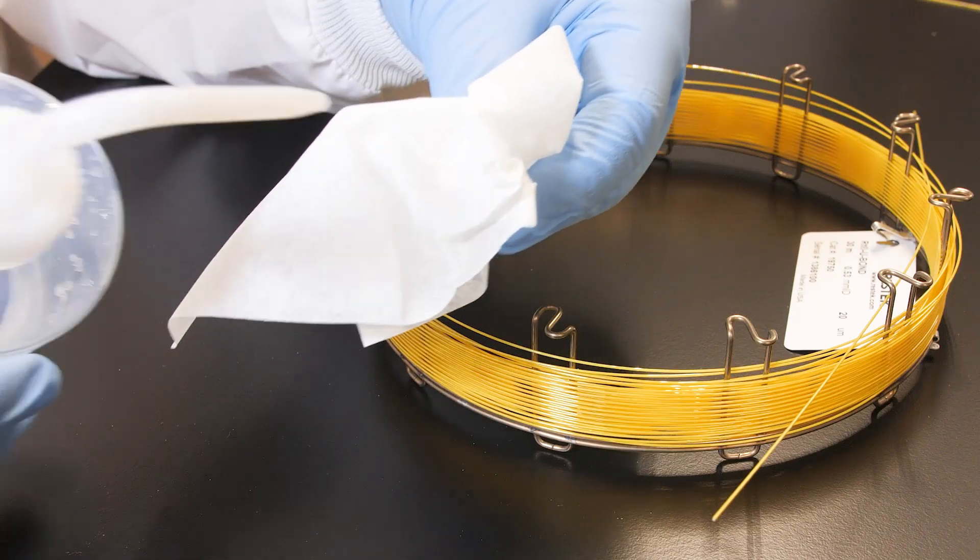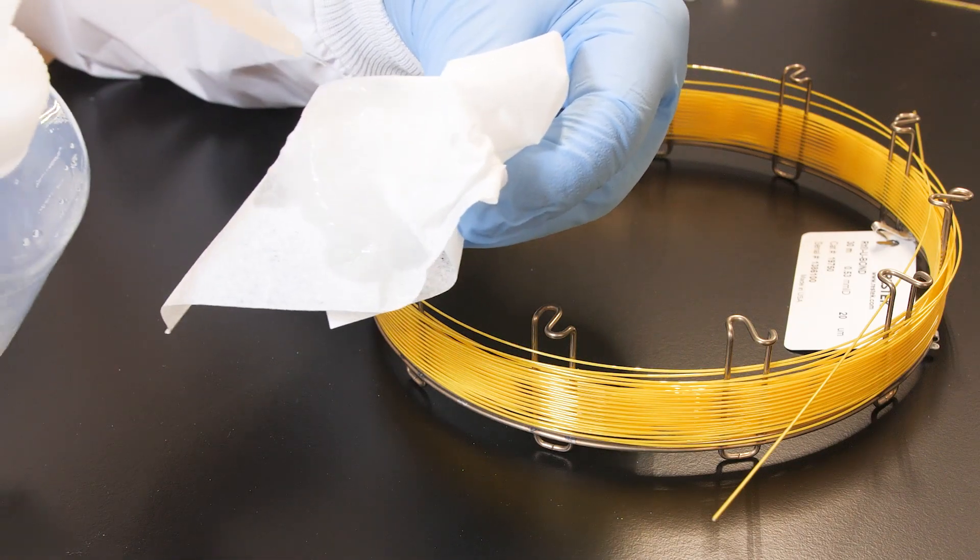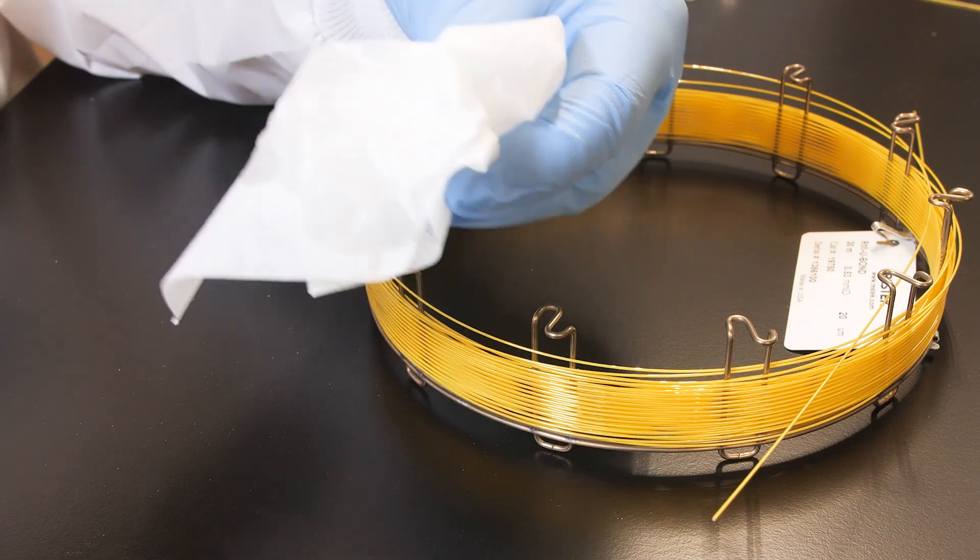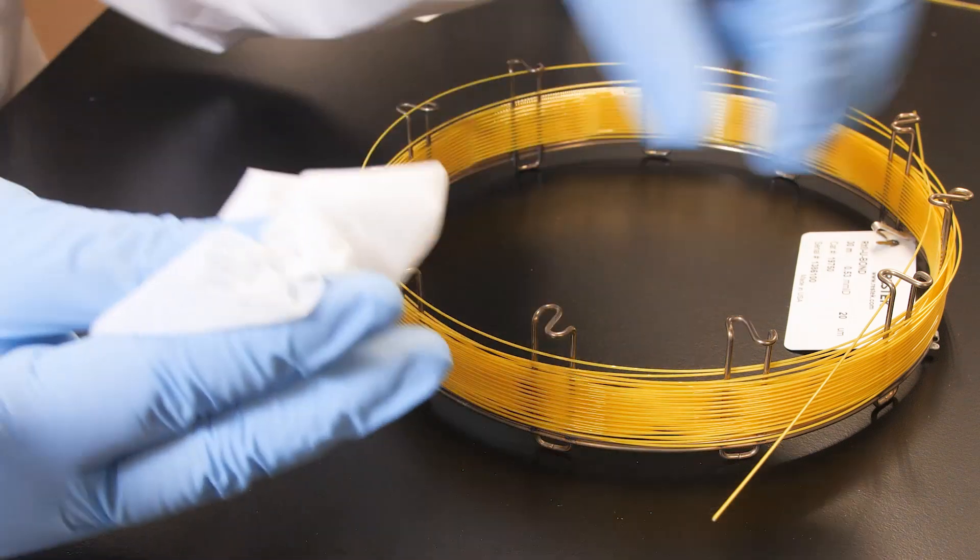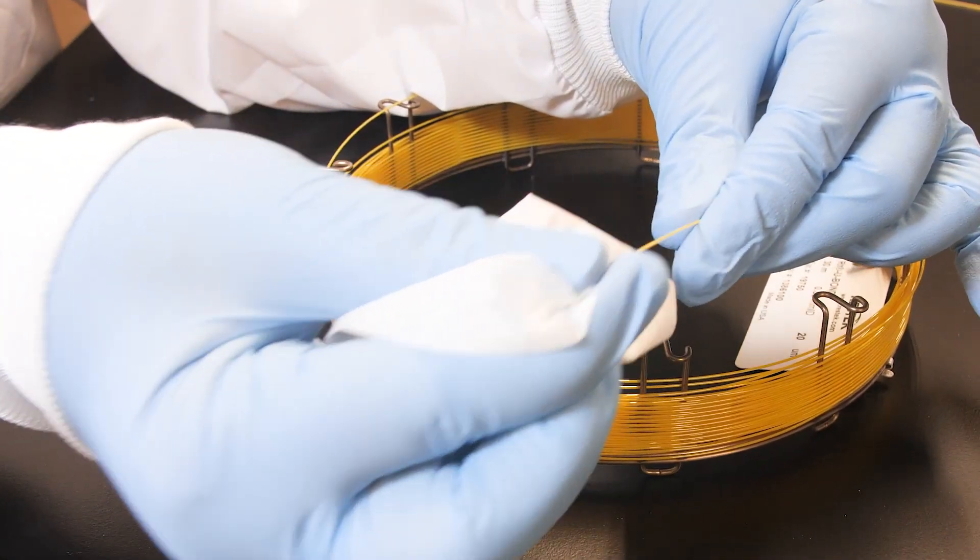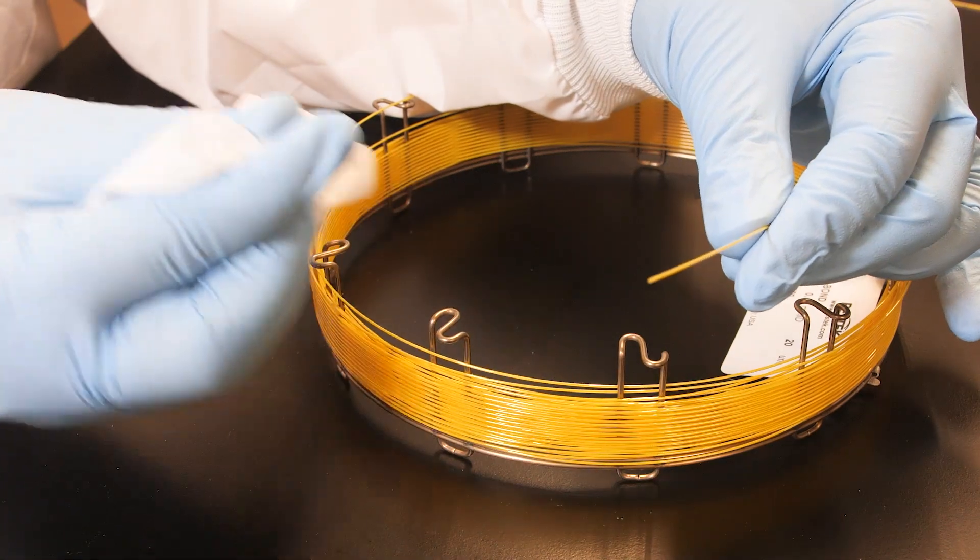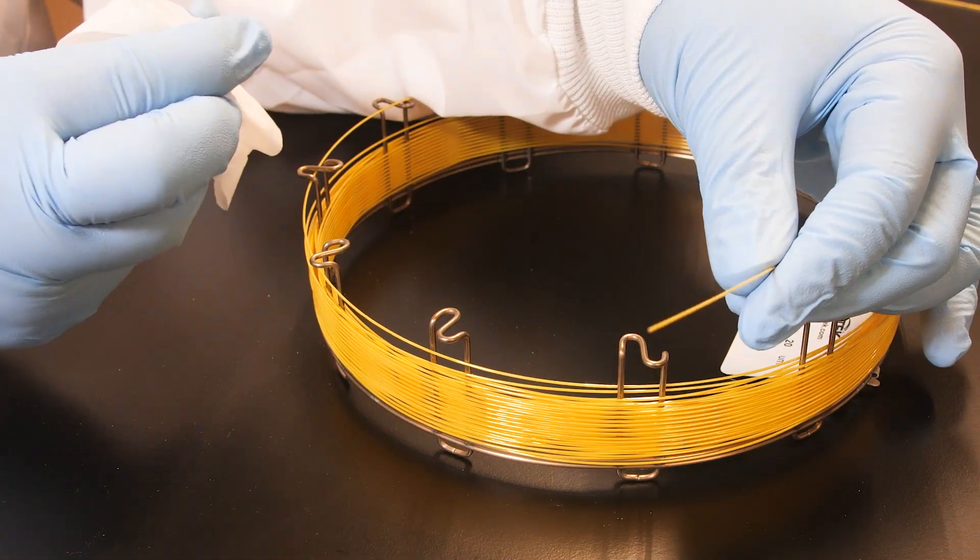Next, we'll prepare the plot column by lightly tapping or flicking the end of the column with your fingers to remove any loose particles. Clean the ends of the plot column and the particle trap with a lint-free wipe moistened with methanol or isopropanol to remove any finger oils and any other impurities.